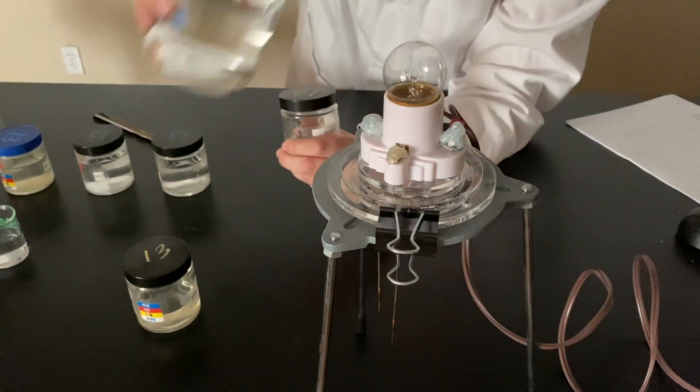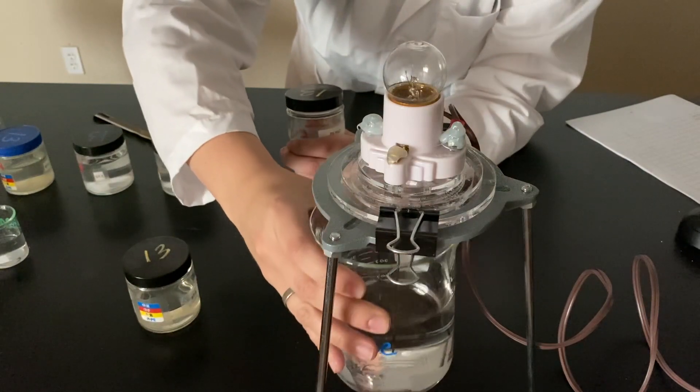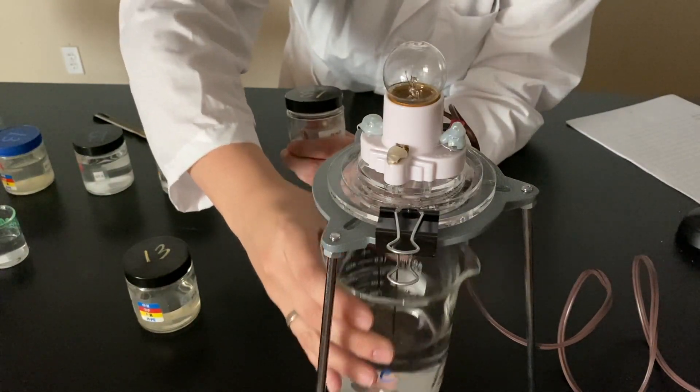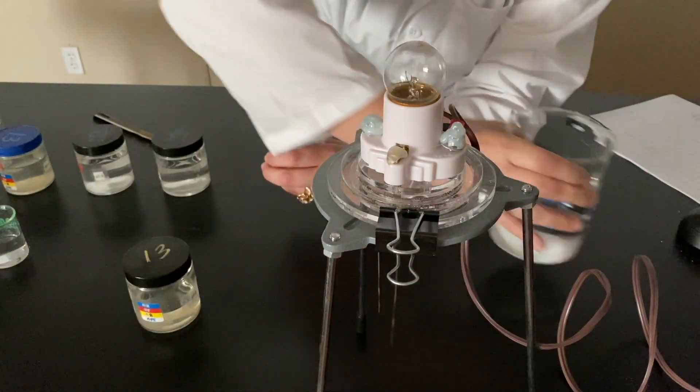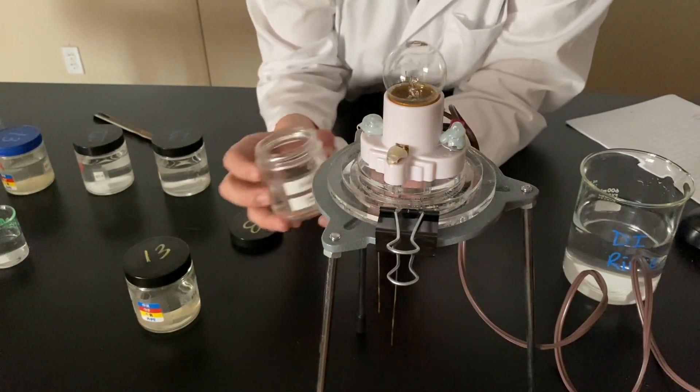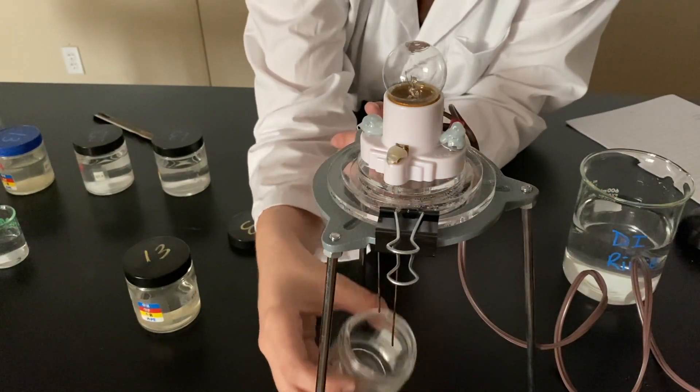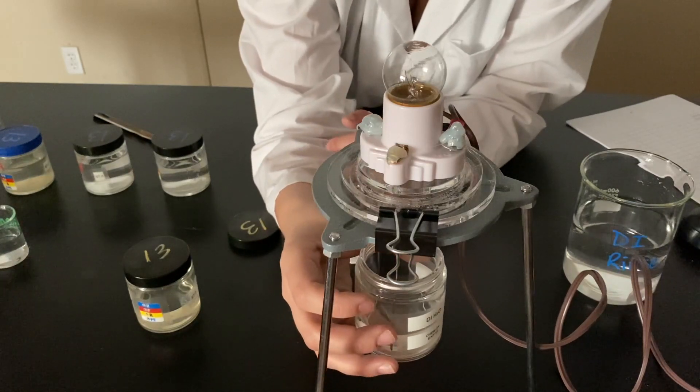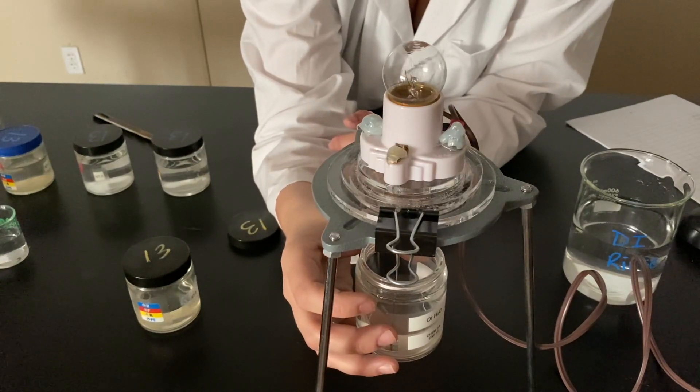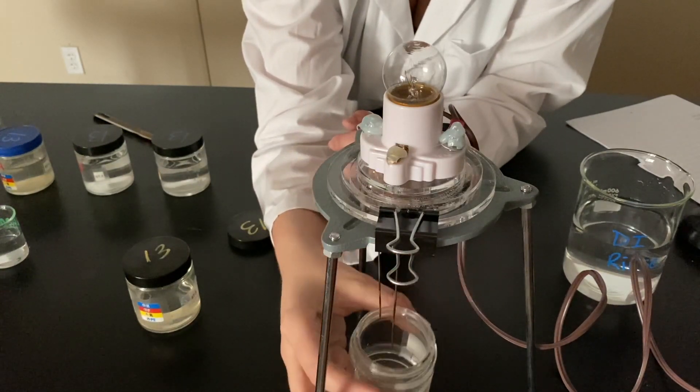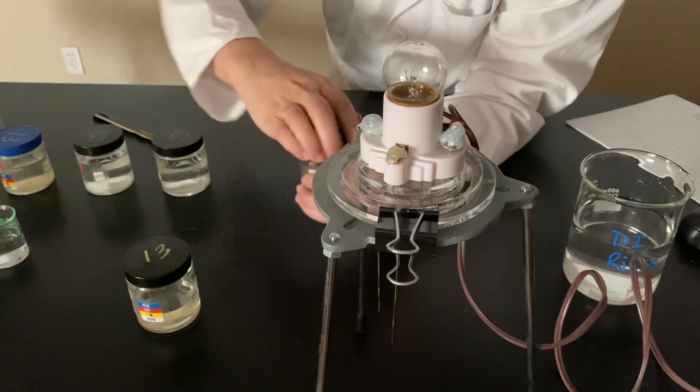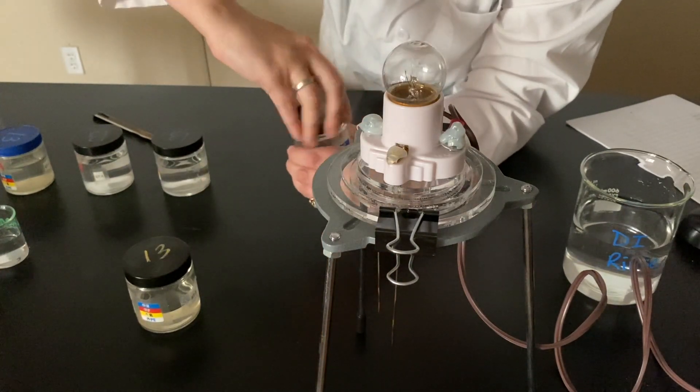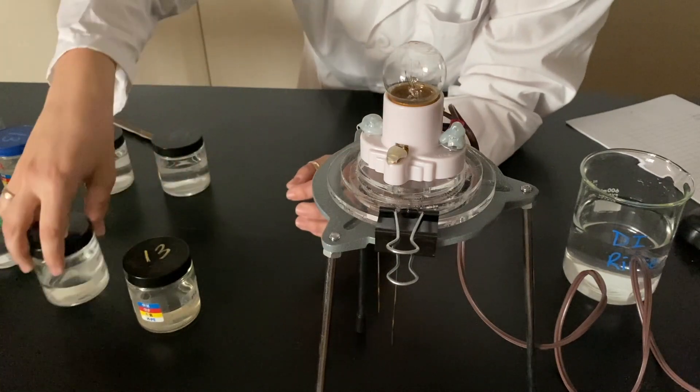And we do a DI rinse. Rinse off those electrodes. We'll keep and here's DI water. We know what's going to happen, but here we go. DI water. Don't need to rinse off DI water with DI water.